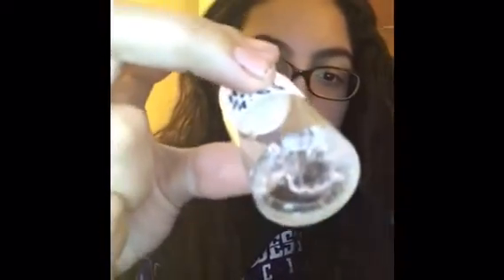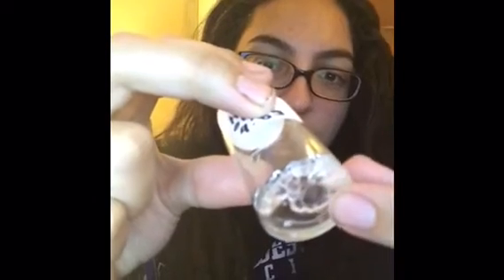If we look into this crystal, it looks really fragmented, and the reason for this is because the evaporation happened too fast. So the temperature might have had an effect, since the crystals had really changing temperatures between cold and hot. This may have affected the growth of my crystal.